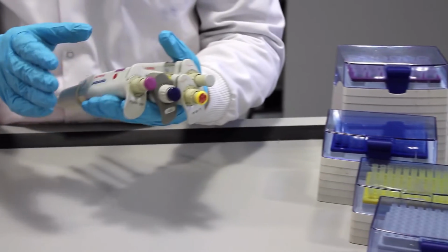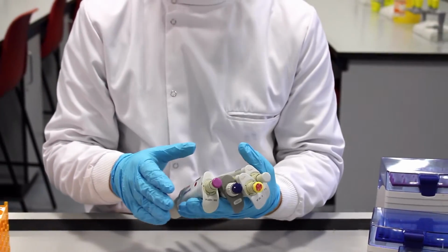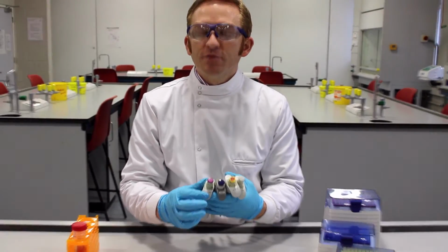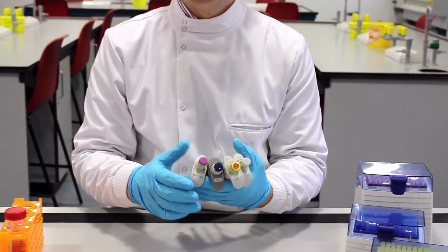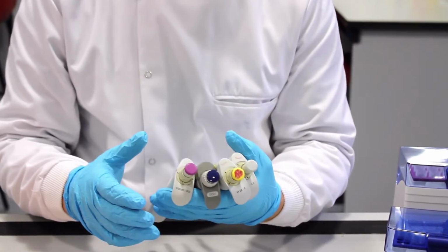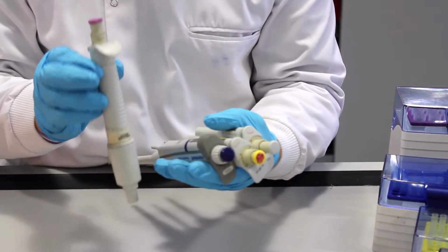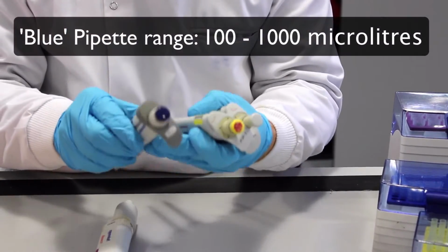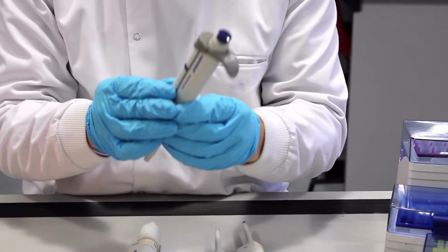Each of these pipettes, probably the most important thing I would say to you to do when you're asked to pipette a volume is to acknowledge the maximum and minimum amounts, which is shown on the top of each pipette. So for example, if I have a particular volume such as 200 microliters that I want to pipette, well then I need to check the minimum and the maximum before I can select the correct pipette. And once I know that information, I'm armed with it and I can select the correct pipette for that.